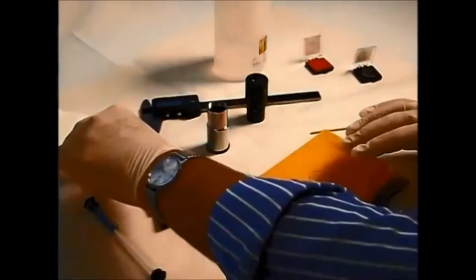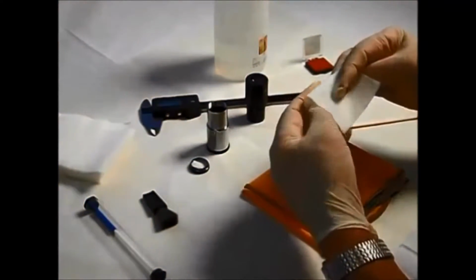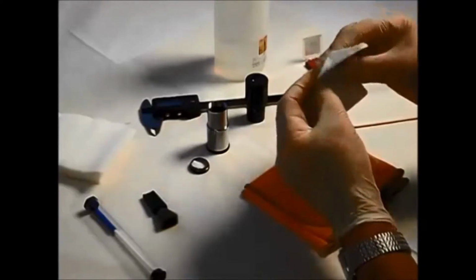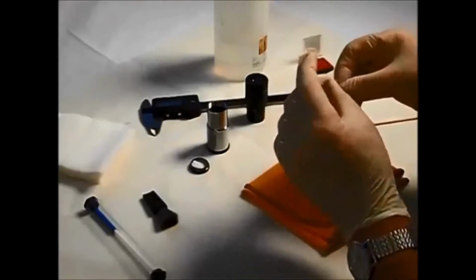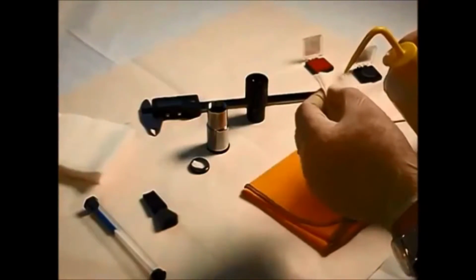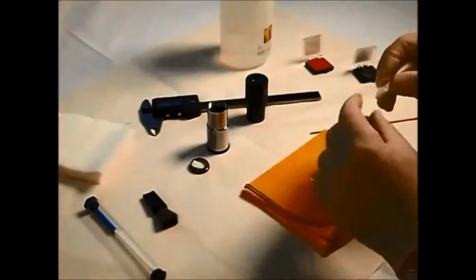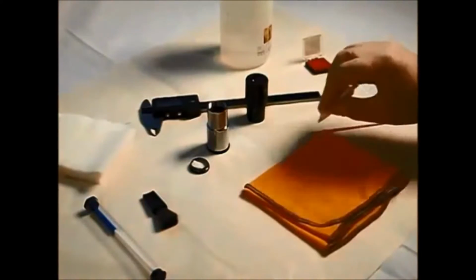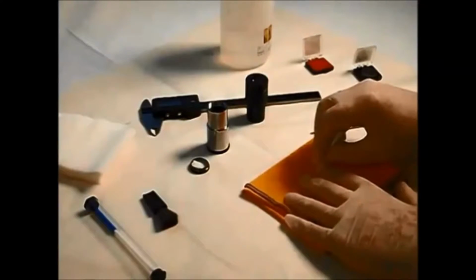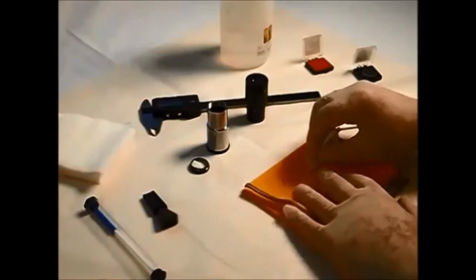So the best way to clean it is take some lint-free tissue like this. If you fold the tissue into a square and use the corner as your cleaning surface, apply some cleaning fluid. There we go. And then working on the eyepiece from the center to the outside in a rotational circular motion like this. Just moving continually to the outside. You're moving any dirt and dust that you trapped to the outside edge.